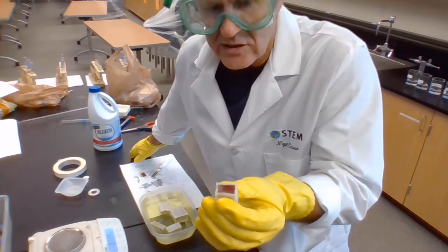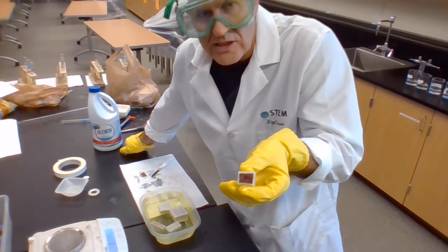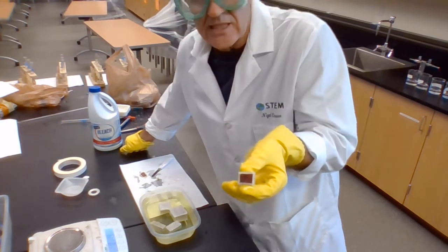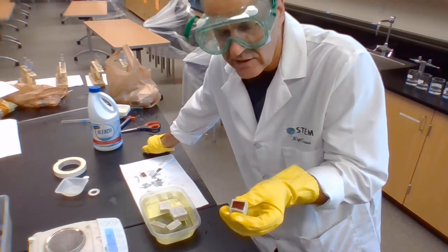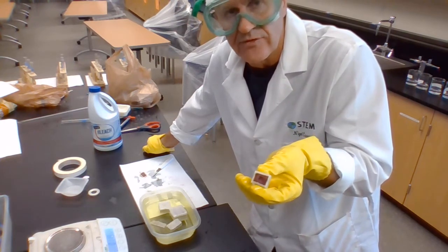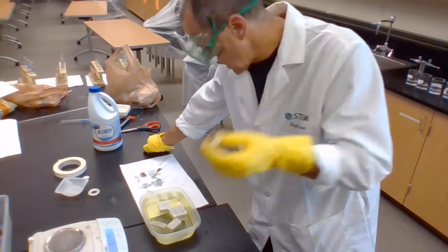It has gone about 2 millimeters, and you can also see that this is going to take an enormous amount of time to go fully. So let's say 1 millimeter every half an hour, 2 millimeters an hour, this is going to be 5 hours before it actually gets oxygen to the whole thing, by which time any cell's going to be dead.